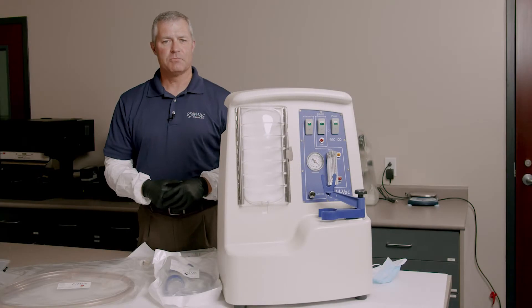My name is Jared Bradley. I'm the president of MVAC Systems and I'm here to show you a demonstration. I'm going to set up the MVAC system, show you how to take a sample, and show you how simple it is.